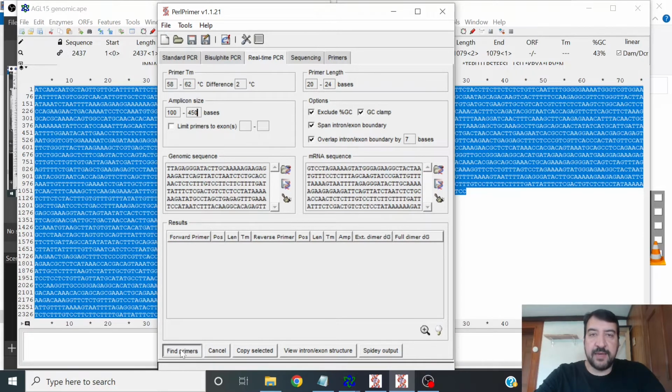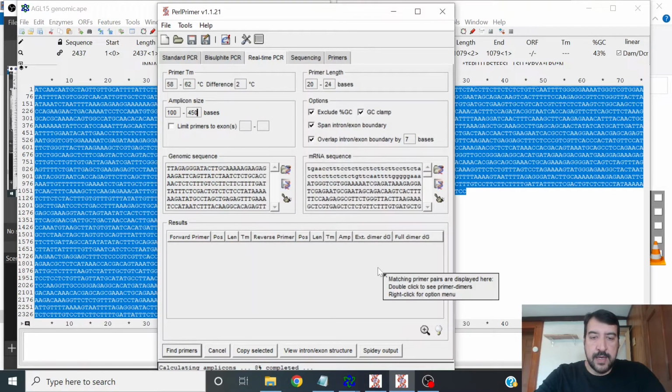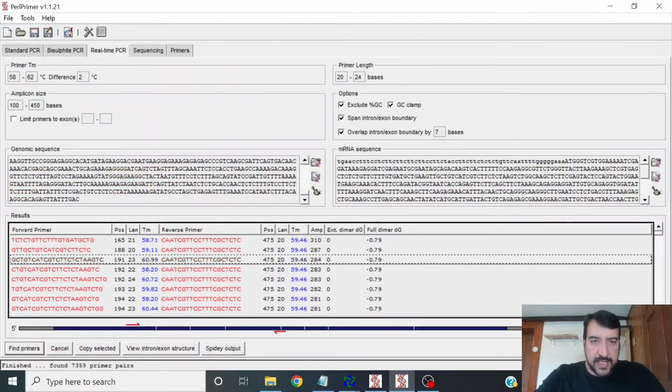Anyway, let's click Find Primers. And we get a dialog that pops up. Don't worry about this. It's going to calculate all possible primers. So it's going to find many more primers than you could find by hand. And if you pick the best ones on the list, which are already sorted, they're going to work every time. There we go. We have all the primers. So let's make that full screen.